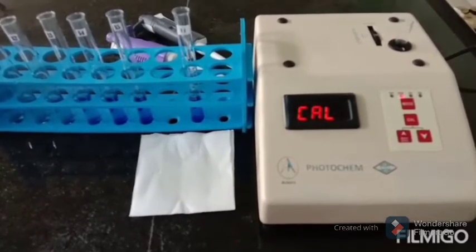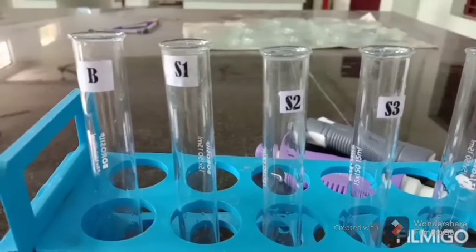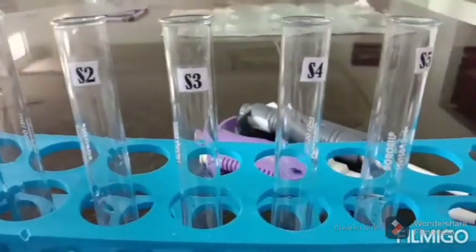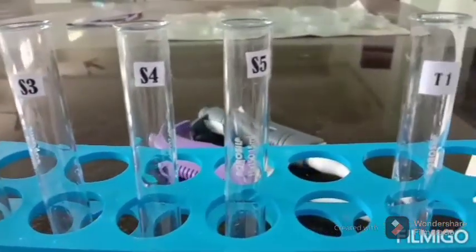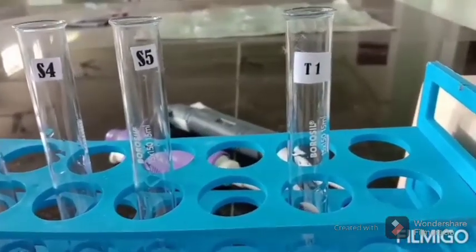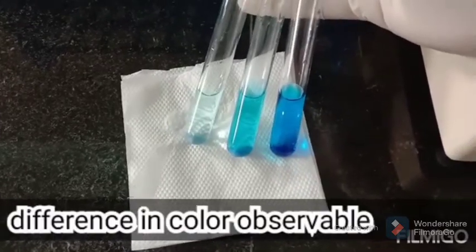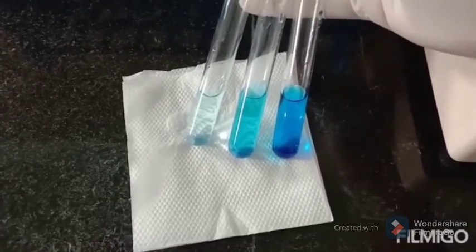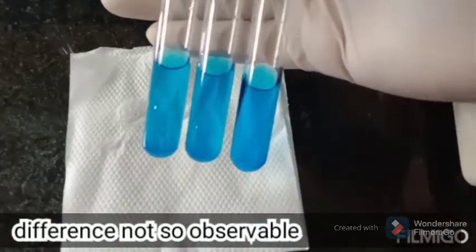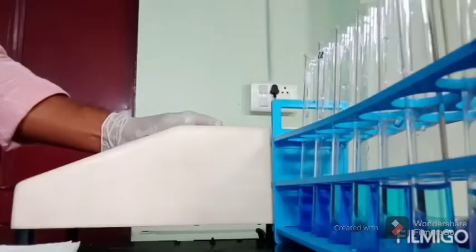Now, here you can see a series of standards and test solutions. This is for the purpose of demonstration using colored solutions. You can see here the difference in color of these solutions is observable, and it's not so observable here. So this is when the instrument actually comes into play to differentiate the exact absorbances.